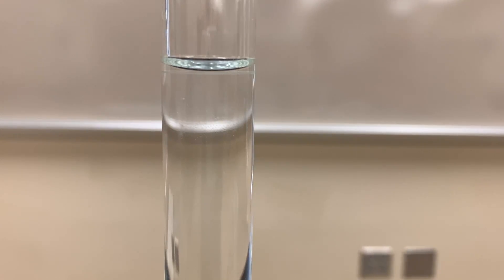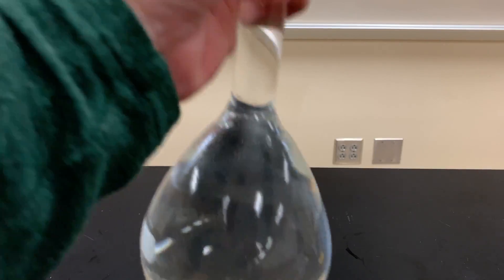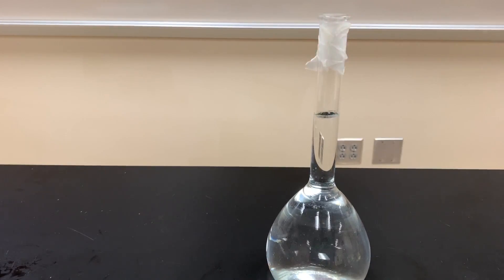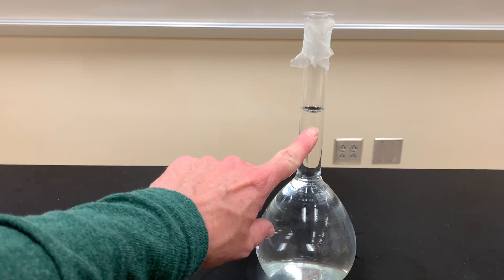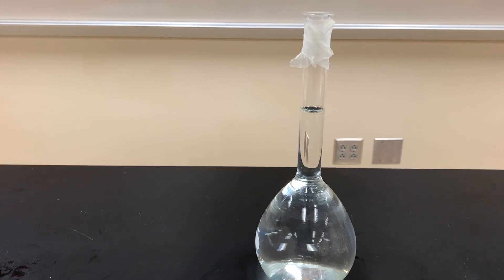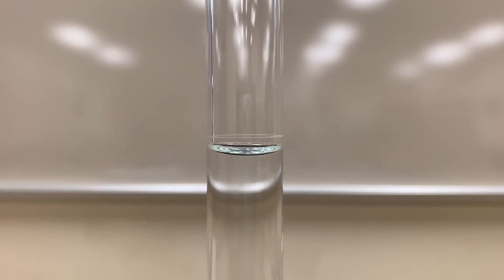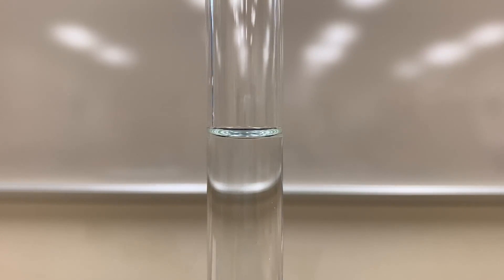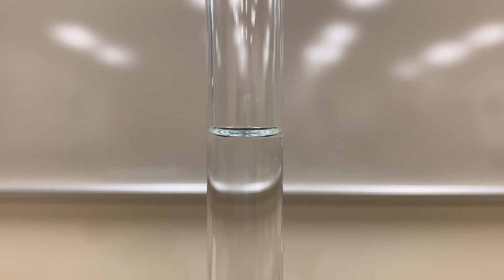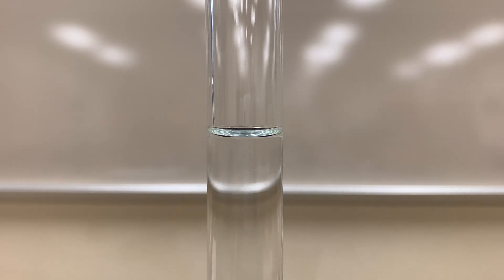Once mixed thoroughly, add distilled water until you reach the neck of the flask, staying below the line. Bring the flask to eye level and slowly add distilled water until the meniscus sits directly on the line. You'll see bubbles — that's just air being released from the solution, not a chemical change. Cover with parafilm, invert again to mix, and check the meniscus. If it drops below the line due to air escaping, add a little more distilled water until it's back on the line. Congratulations — you've made 500 mL of 0.100 molar sodium chloride from 0.500 molar sodium chloride stock solution.